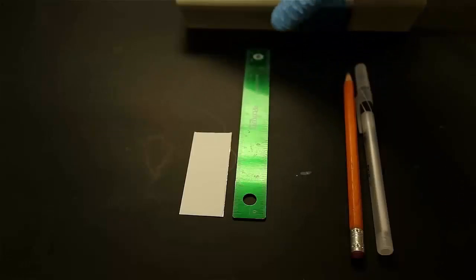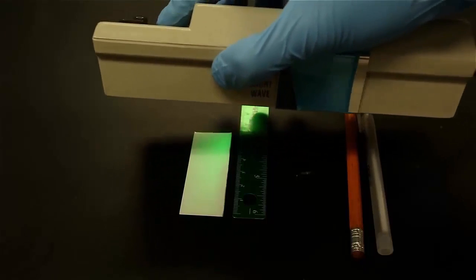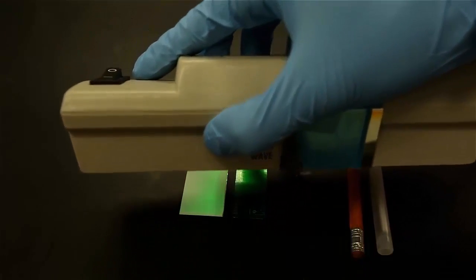When handling the TLC plate, be sure to avoid touching the surface of the plate, as the fingerprints will appear under the UV light.